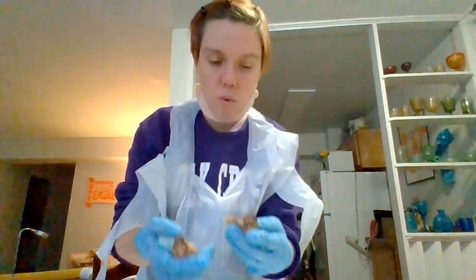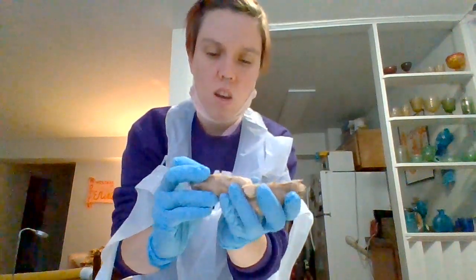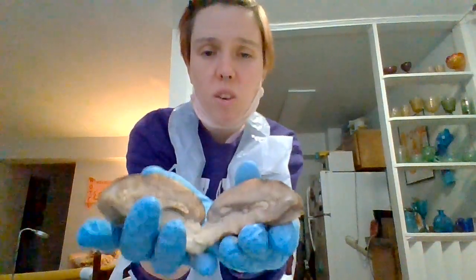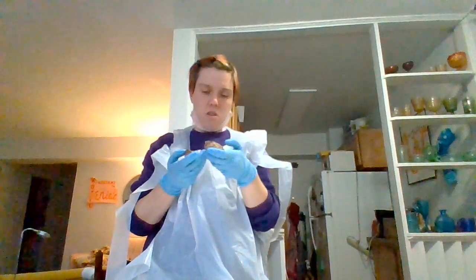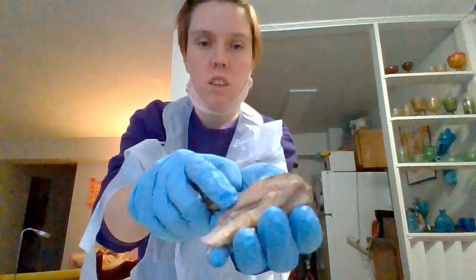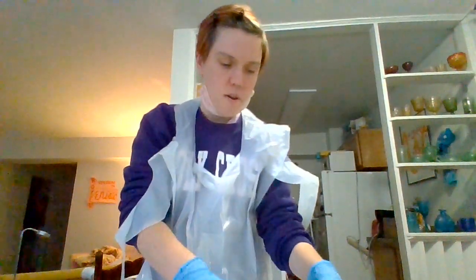And then there's white matter. The white matter is the nerve tissue almost. You can definitely see it there, all throughout here is the white matter, if that makes sense. So I hope you were able to see the brain structures here. Some of them, yeah. And these interestingly darker things are cranial nerves. I think they look really interesting. So that's just a bonus.